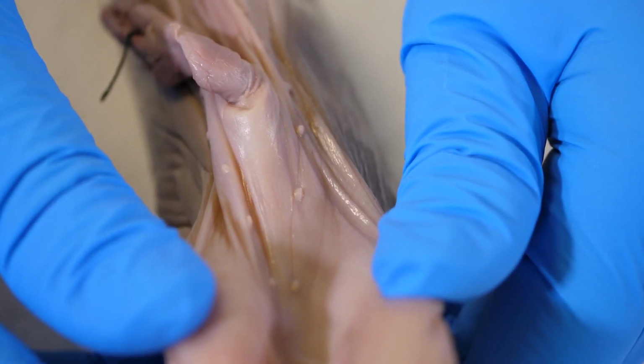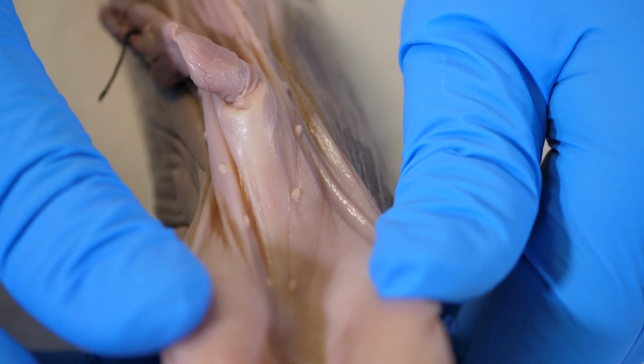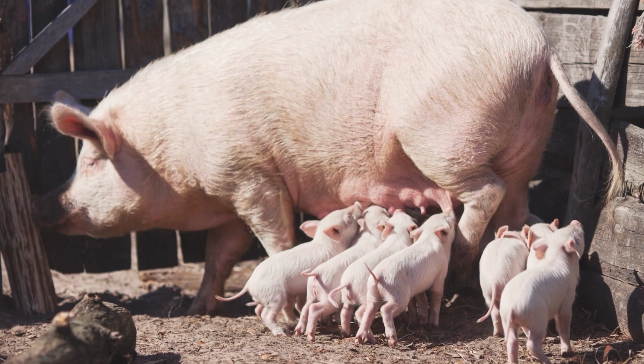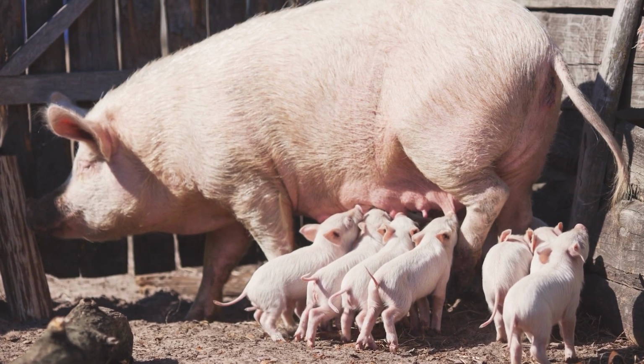2 rows of bumps are also visible on the pig's ventral side. These are the mammary papillae. Both male and female pigs have mammary papillae, but only the female pig develops mammary glands. Mammary glands are another feature distinctive to mammals.